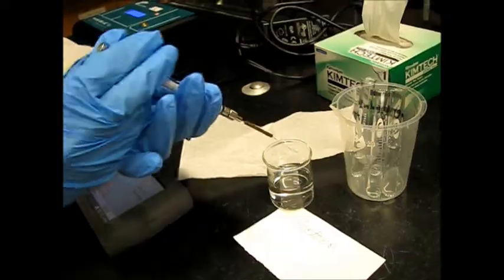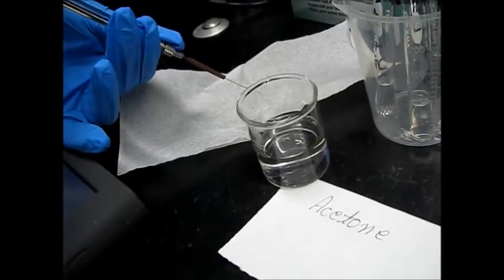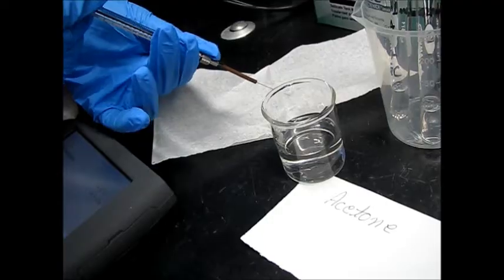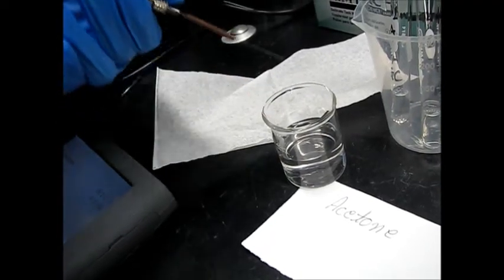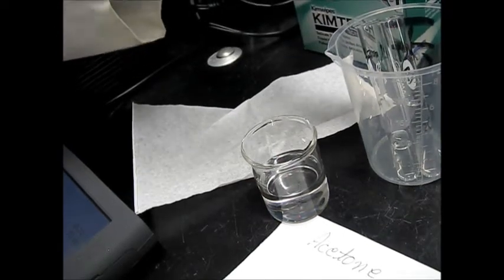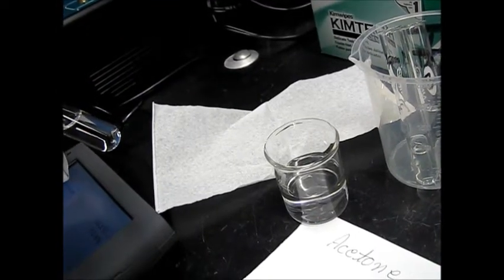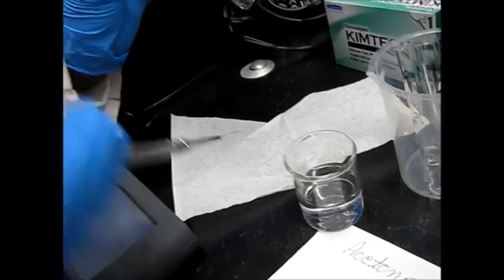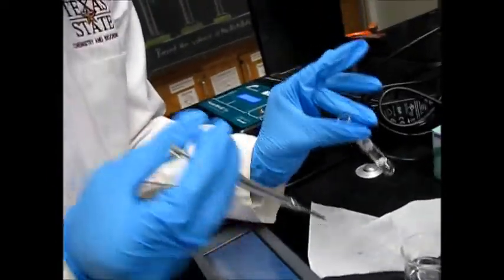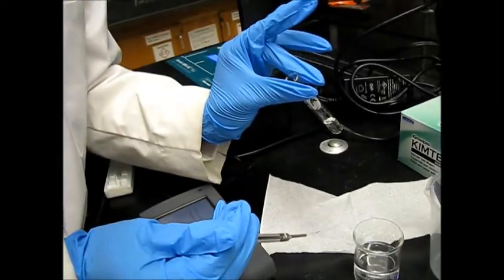First, I'm going to use acetone. So I'm going to get a little bit of acetone, about 3.3, max of five. That's the most. I'm going to get another. Do this about three times with acetone. Now, now that I've done that with acetone, I'm going to get sample A and I'm going to do three times rinse with sample A. So I'm going to insert, get some of the sample and rinse. And we should not remove the needle all the way out. Just only a small amount.